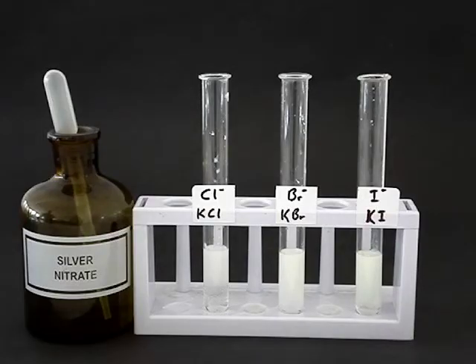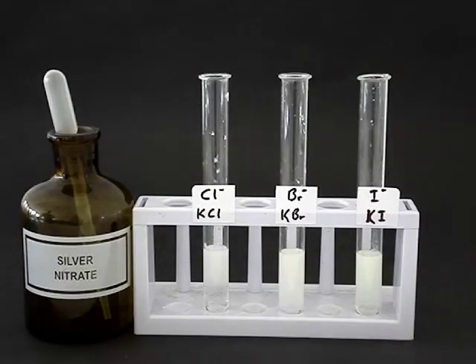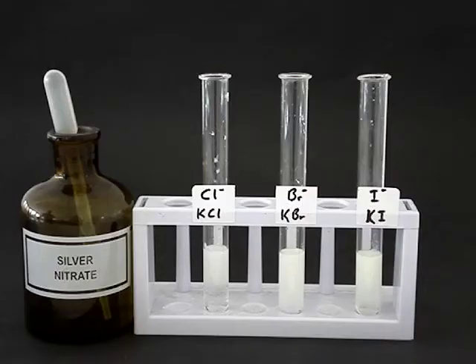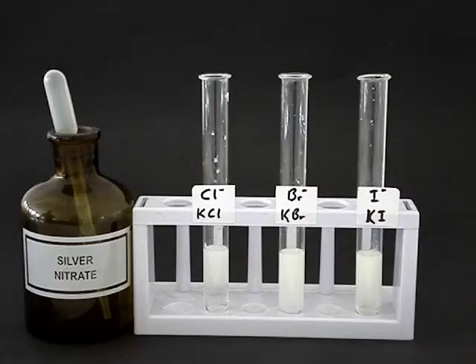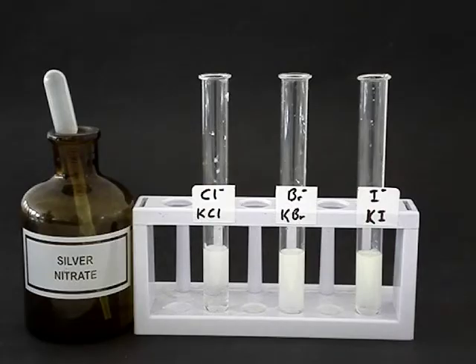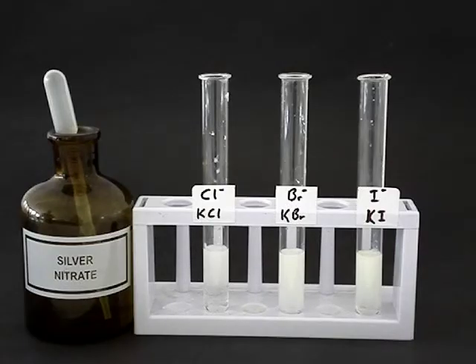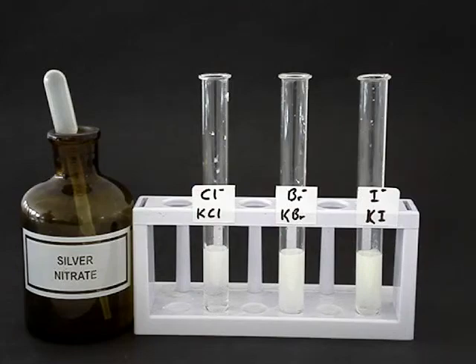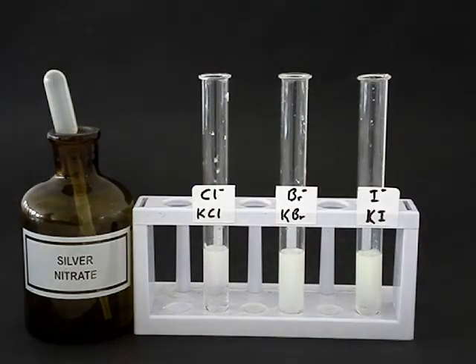So this is a test for each of these halides. Had we not known what the substances were inside these test tubes at the start, we would have reasoned like this: we add some silver nitrate to the first one, it forms a white colored precipitate — that must be silver chloride, which tells us a chloride was present at the start.